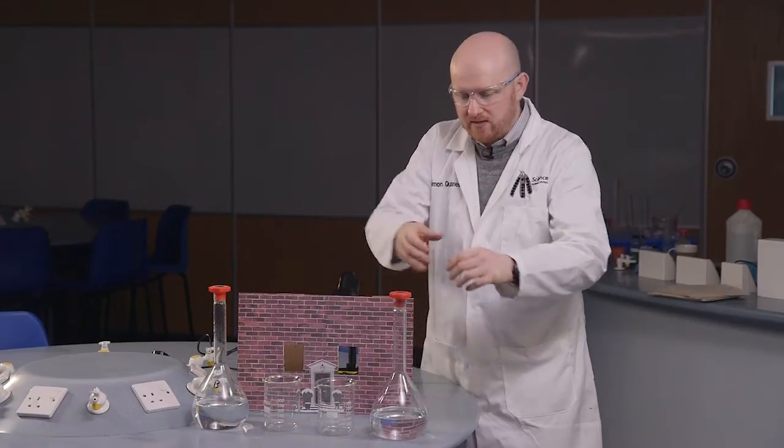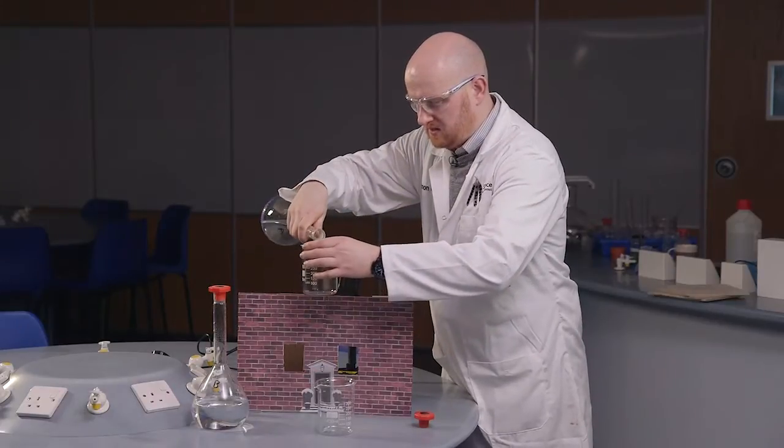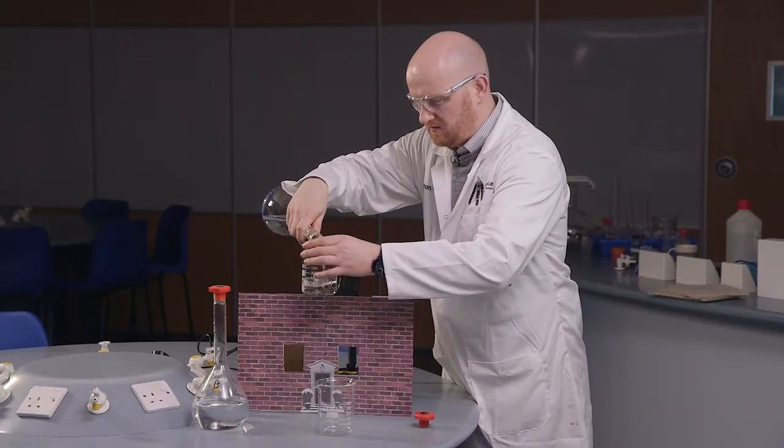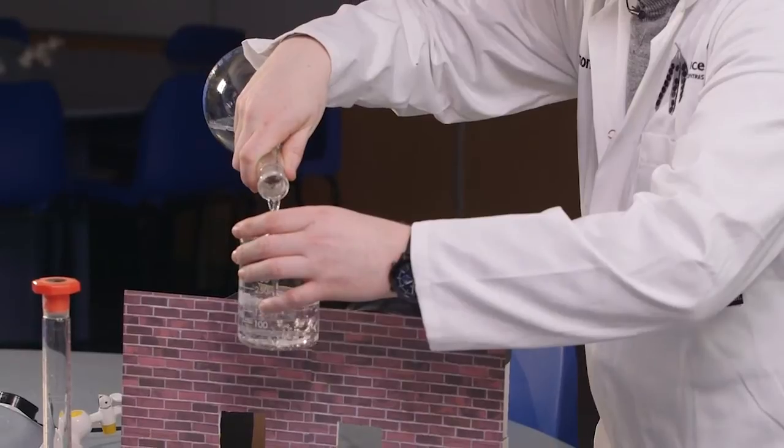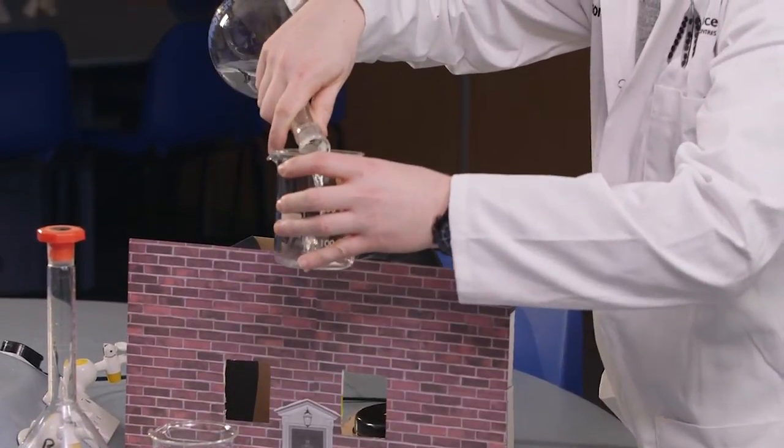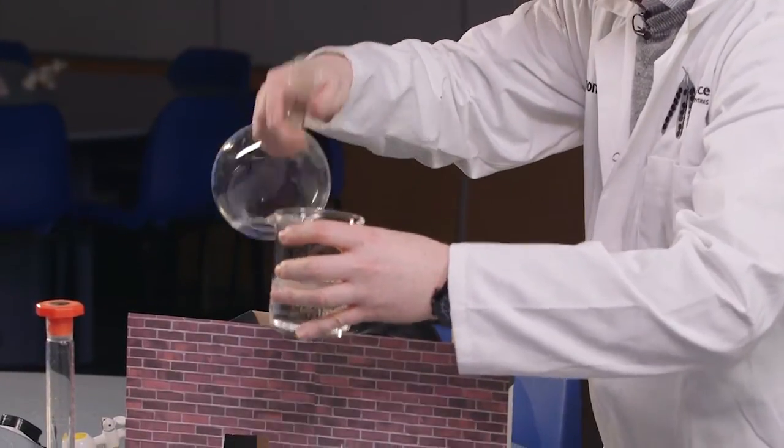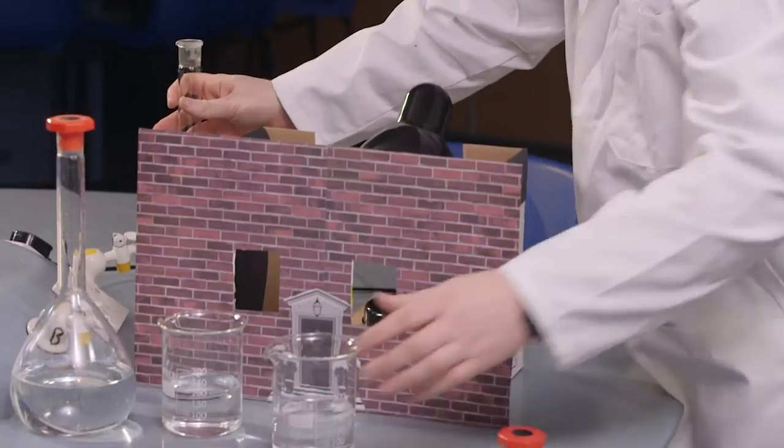So we're going to take solution A and I'm going to add this, about 200 milliliters, halfway filled, to each of our beakers. Like so. Just put that round the back there.